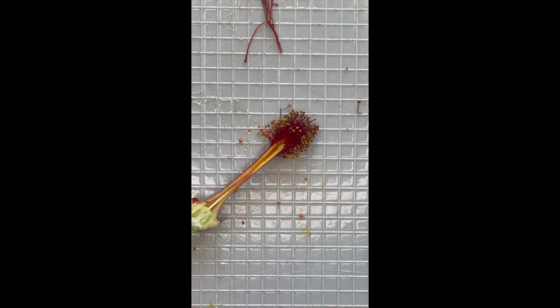And you will have different types of flowers in the classroom than this. Hopefully a little bit bigger, so you can handle them a bit easier. But you'll see, even though all of your flowers look a little bit different, they all have the same parts. They might have a different number of stigmas. Some only have one. They might have a different number of anthers and filaments, or the stamens. They'll have a different number of petals, possibly. So it'll be fun to observe and compare the flowers that you have in the classroom with the other students in your class, but also with the one that I have here.